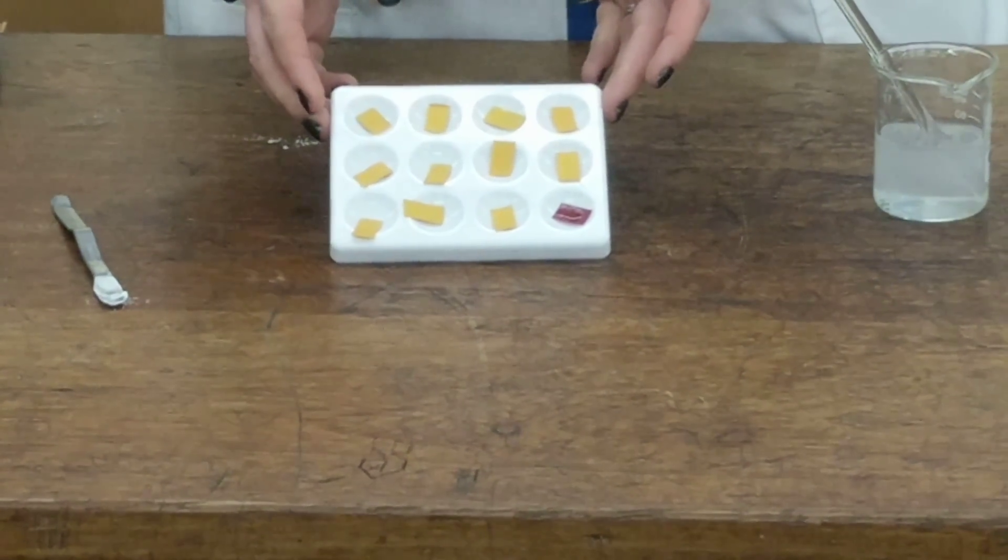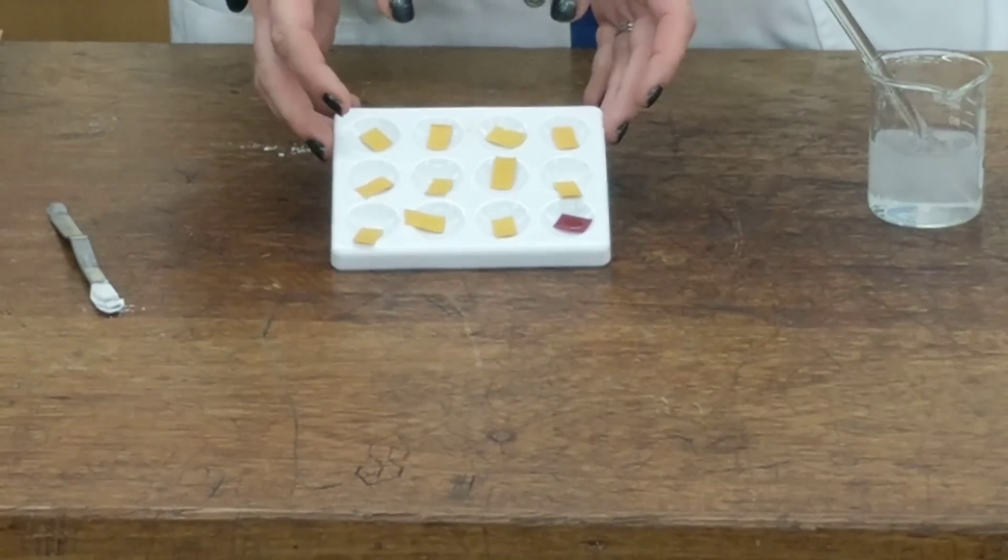And as you can see, it is red, showing that there is excess of acid.